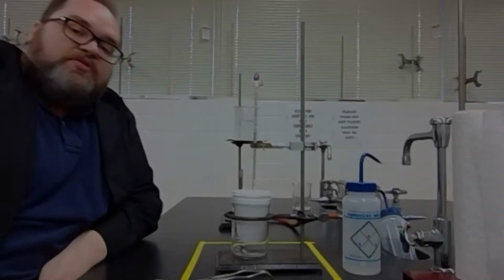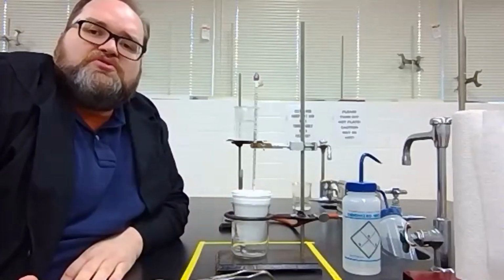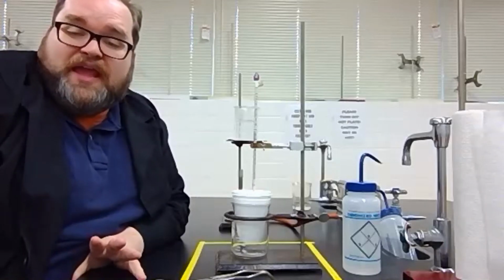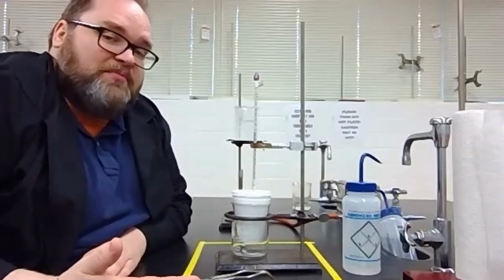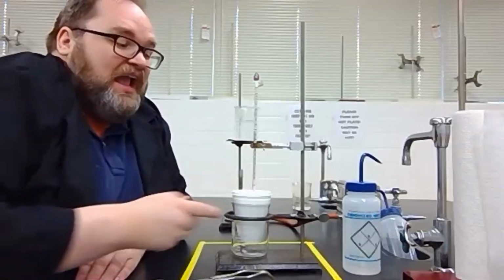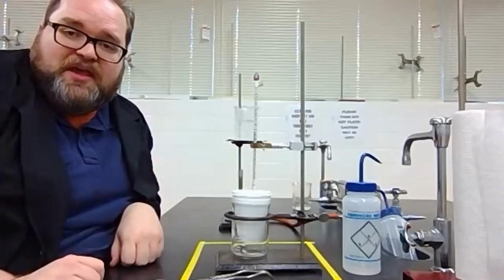Now, there is one other measurement that we could take in a coffee cup calorimeter. That is how the energy is exchanged for a reaction, say neutralization, that takes place in water. And the way we do this is incredibly similar to what we've done already, except instead of using a piece of metal and water that's already in the cup, we actually take 2 beakers, one that has an acid and one that has a base.